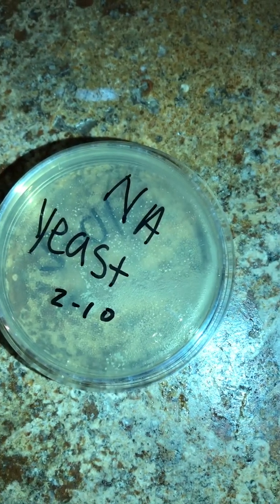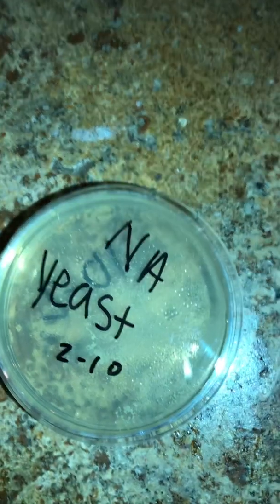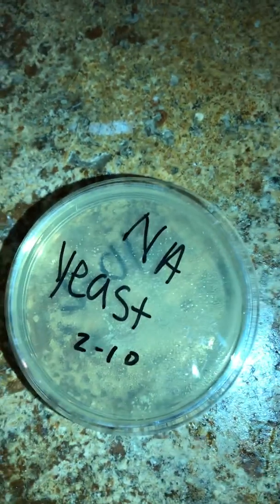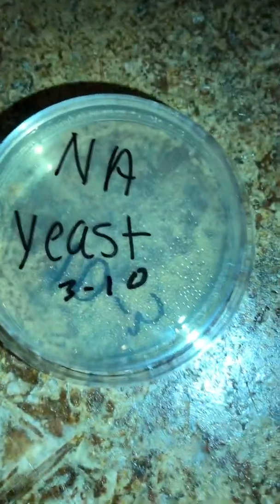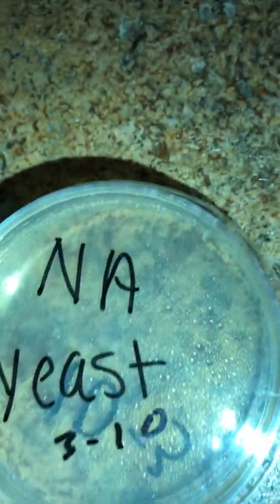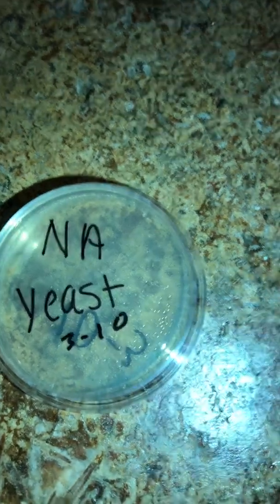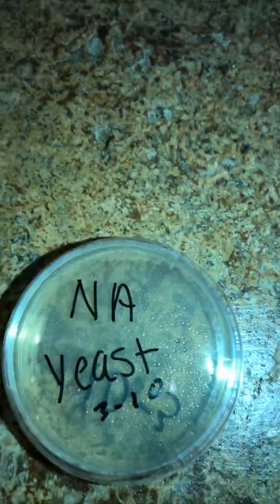And then specimen 2, that one also has a really large amount of S. cerevisiae, and I would not be able to calculate the amount. It's just way too many. This one is less. There's a little steam or something on the glass, so don't count those, but they kind of got spread in the corner. I don't know if you can see that, but it's still too many to count, so I wouldn't consider that a viable specimen.